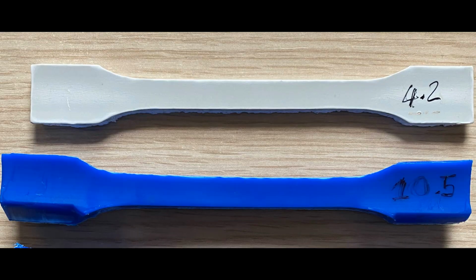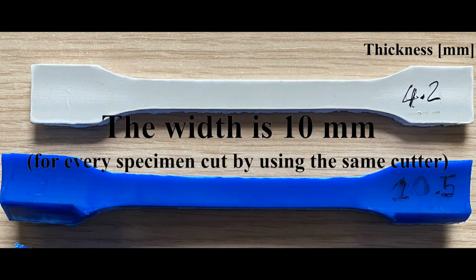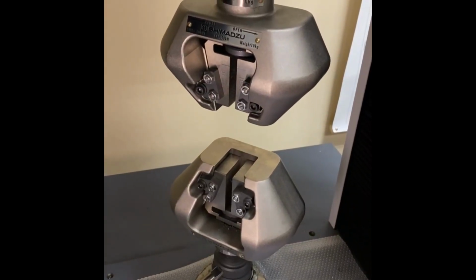Flat or circular plastic or steel samples with various dimensions could be used. In the experiment, PVC and high-density polyethylene, HDPE, polymer samples will be tested for tensile test properties. Now, we are ready to carry out the experiment.